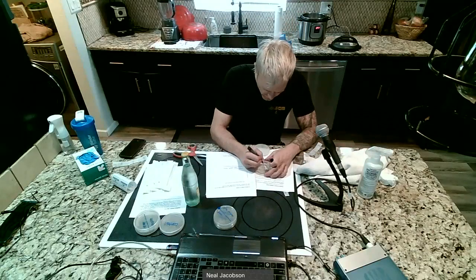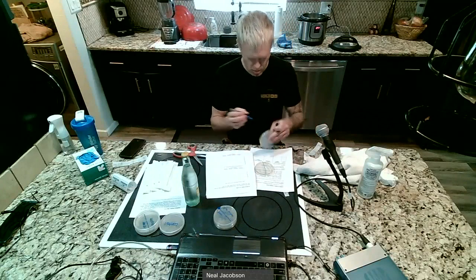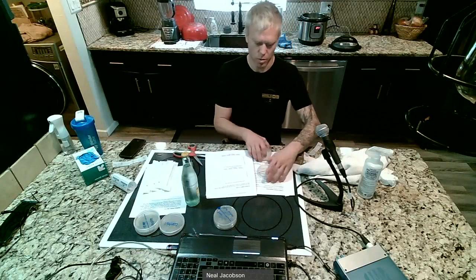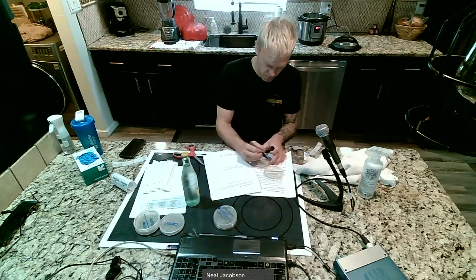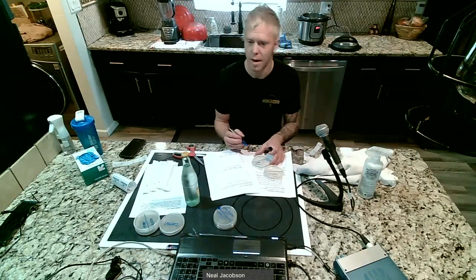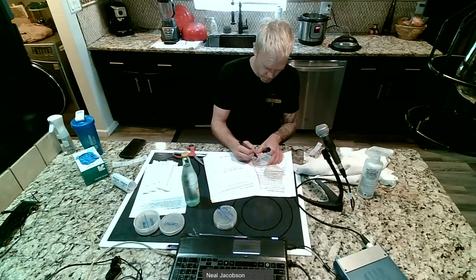So we'll divide the plate in half on the bottom. And half is going to, we'll pick what we're going to do. I'm going to do cell phone for sure. Cell phone and TV remote. That's going to be one of mine.